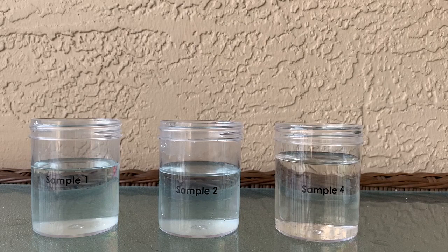For our water testing today, we're going to be using these three water samples: sample one, sample two, and sample four. Each of these samples looks pretty close in similarity — they're all kind of clear water samples, but they are all a little bit different.